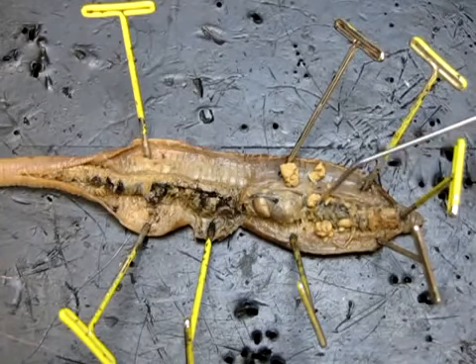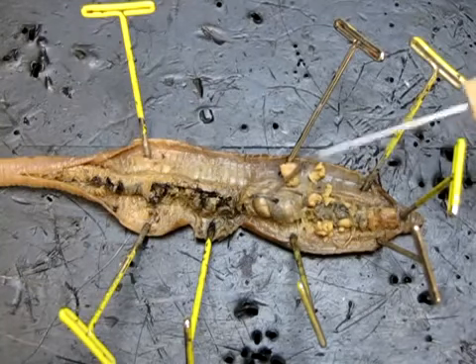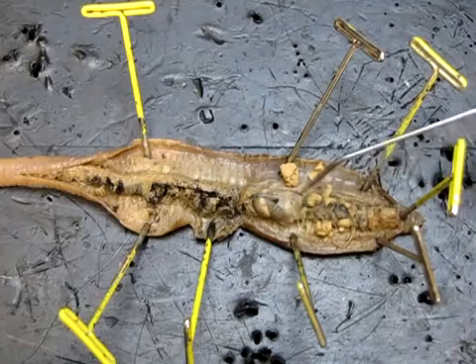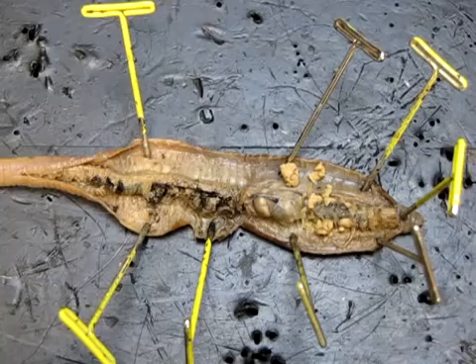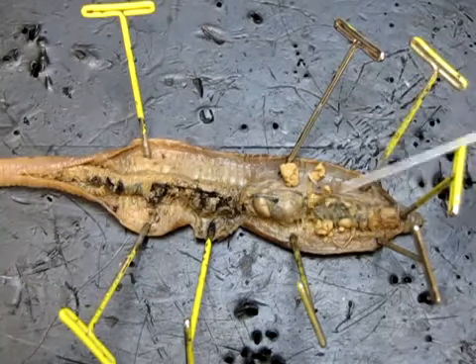So these aortic arches wrap around. They act like rings that wrap around from the dorsal to the ventral side, allowing blood to flow basically front to back, okay? So that's the heart, and then we have the blood vessels there. And I think that those are the main structures that I would like you to know for this exam.